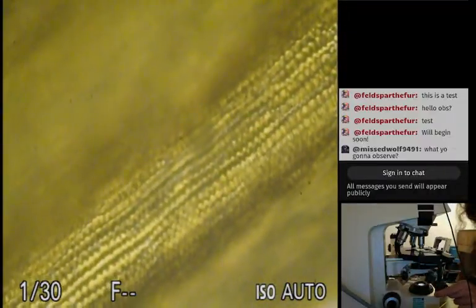And if you're wondering what on earth my setup is, it's this big boy right here. So down here we've got the area where I mess with all the microscope bits and jiggle it left and right and up and down. Well, up and down would work if it was not sticking to the tray because the bottom was wet. Ooh.